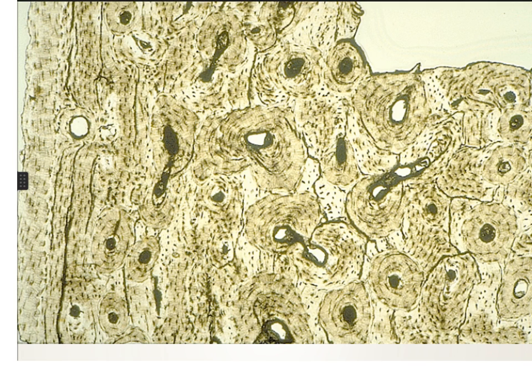So this is the ground bone, and it is compact because it has the regular arrangement of this Haversian system here, so it is a compact bone and not a spongy bone. Moreover, the spongy bone cannot be prepared by the grinding method as it is very fragile, so it will be damaged by this method.